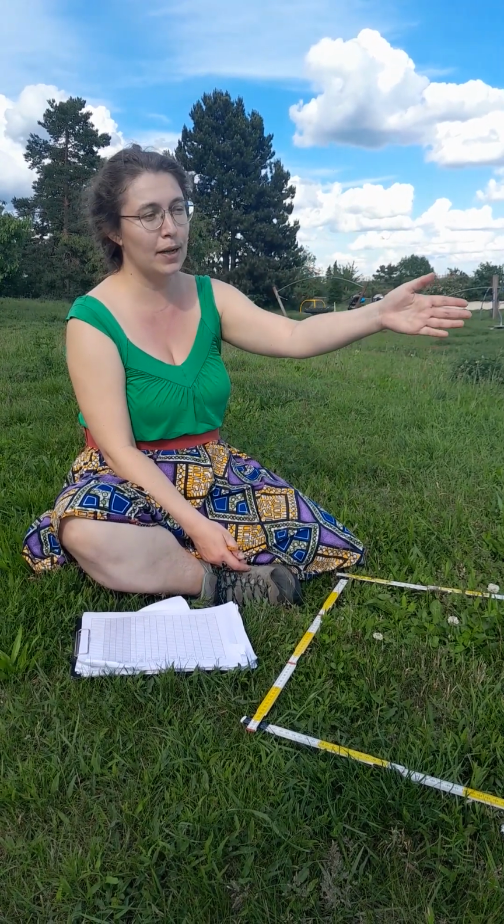And you continue repeating the 3 big steps, sampling again until you have a total of 20 sampled patches for which you have preserved flowers in ethanol. You can sample more than 20 patches, but you do stop when you have 20 vials of preserved flowers.